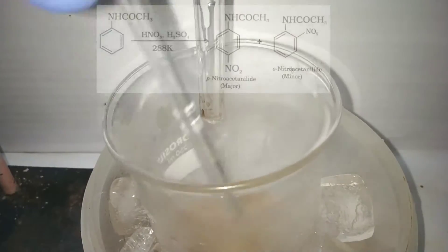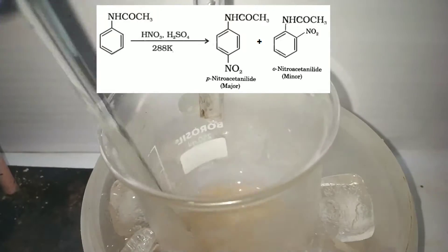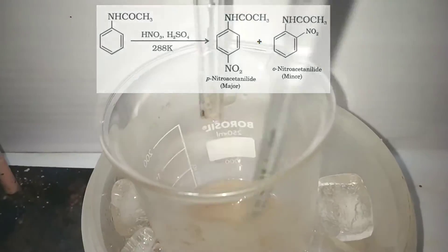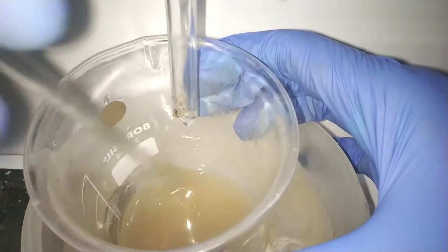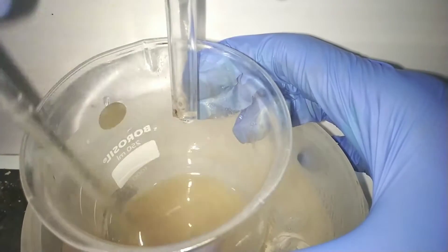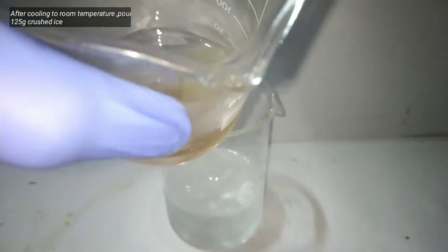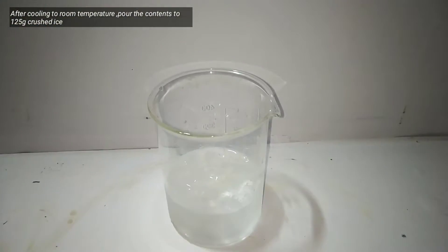What is happening here is acetanilide gets nitrated in the para position, forming paranitroacetanilide. After all the mixed acid has been added, remove the beaker from the ice bath and allow it to stand at room temperature for 30 minutes.